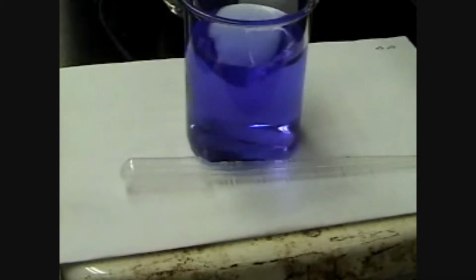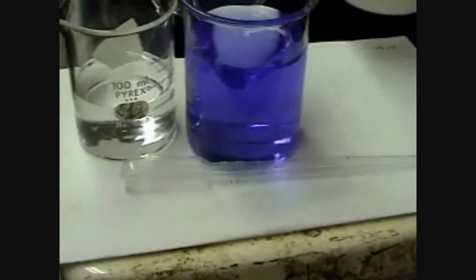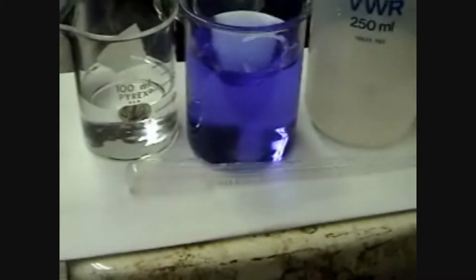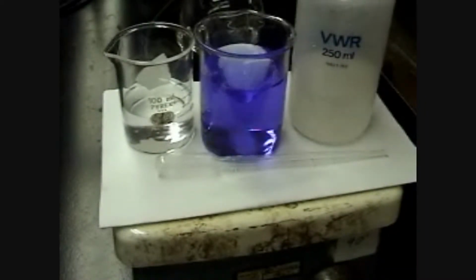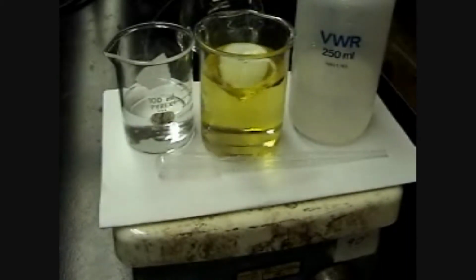All right, and I grabbed another beaker and I put a little bit of acid in that beaker, and then we have the sodium hydroxide solution right there. I'm gonna pull that open a little bit. So see what happens when we add a little acid to this mixture. One drop at a time. Definitely should be turning it acidic. There we go.